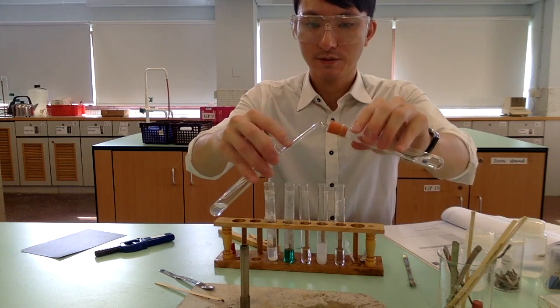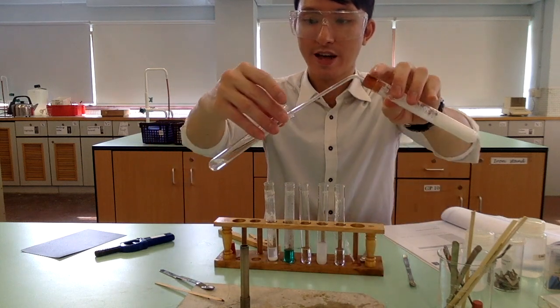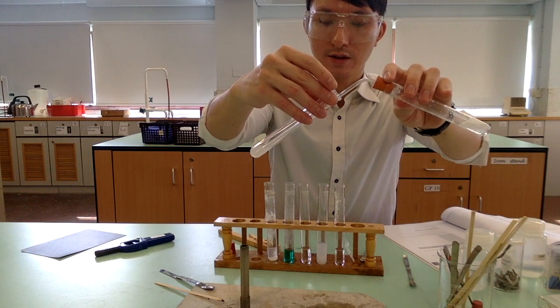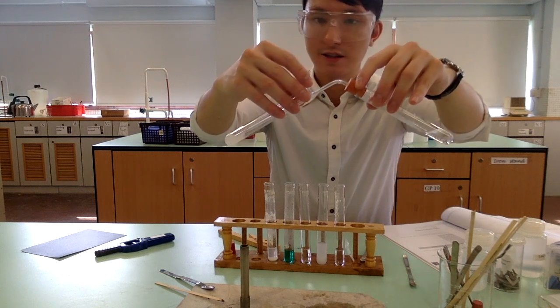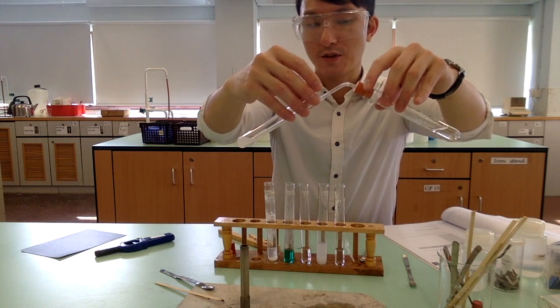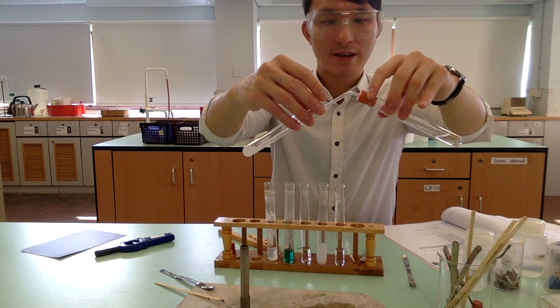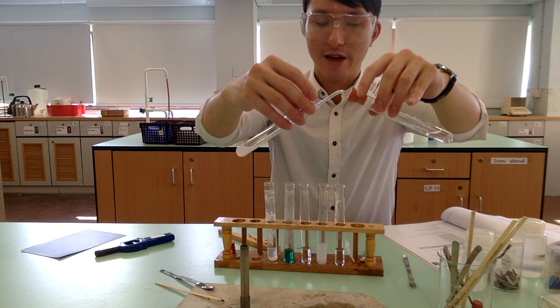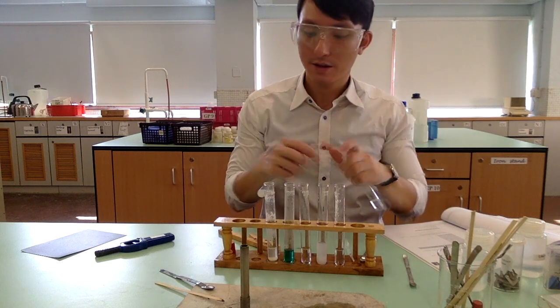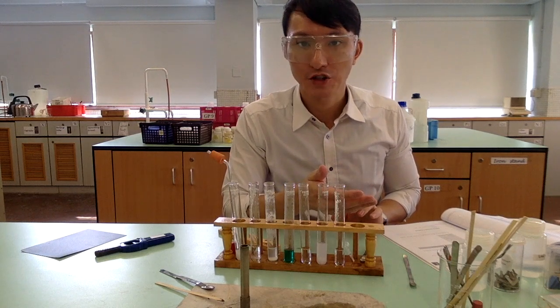Oh, yeah. It's quite difficult to drop it in, so I'm actually going to drop it in first and then reconnect. Okay, so obviously you see that the reaction has taken place in a similar manner, and you will see bubbling occur on the test tube where the acid is, as well as the lime water turning milky. So again, this experiment shows that the reaction between hydrogen carbonate and acid is able to produce carbon dioxide. So that basically shows you all the typical reactions with acid.